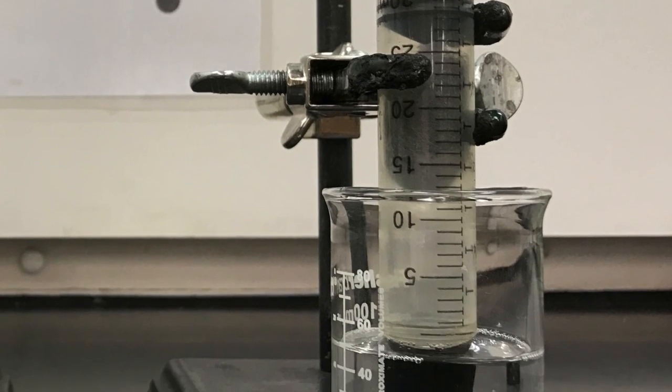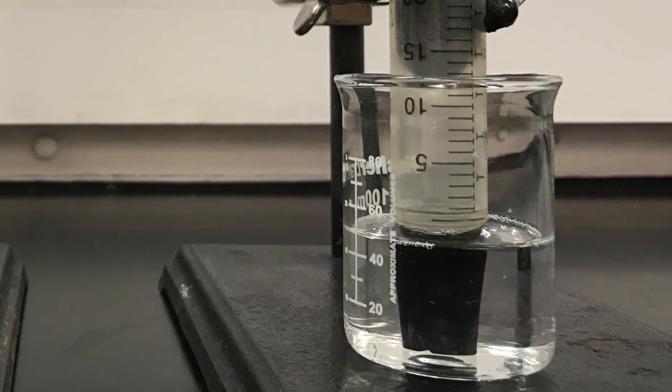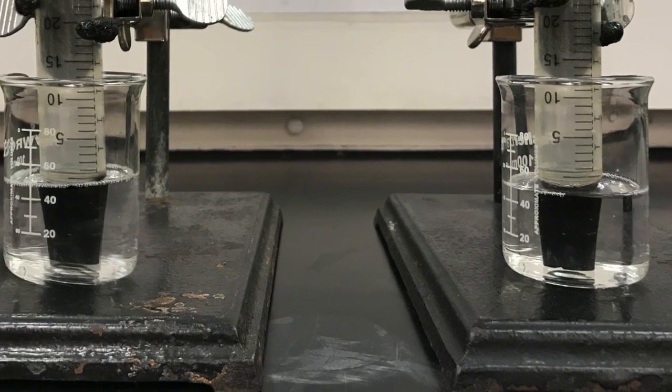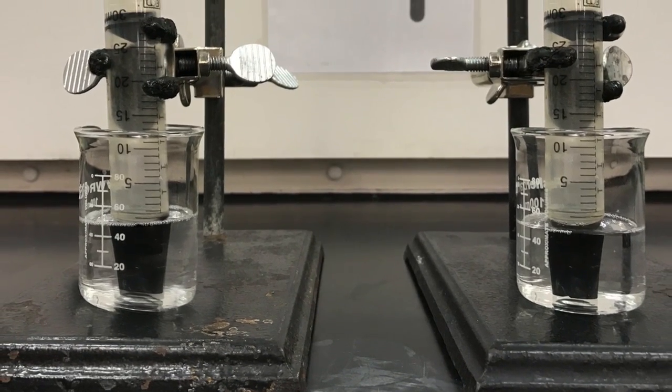And that should be the setup that your second syringe should look like. Then once you've successfully set up both of your syringes, this is what your complete lab setup should look like.